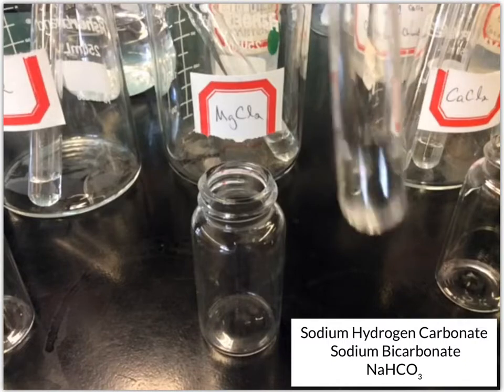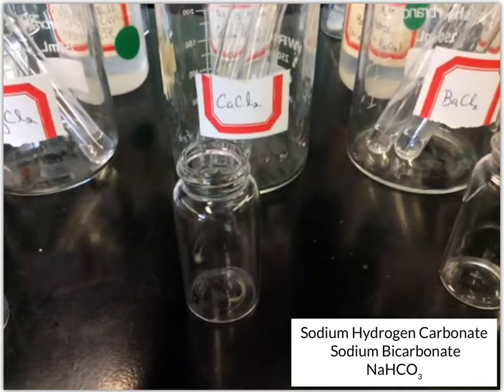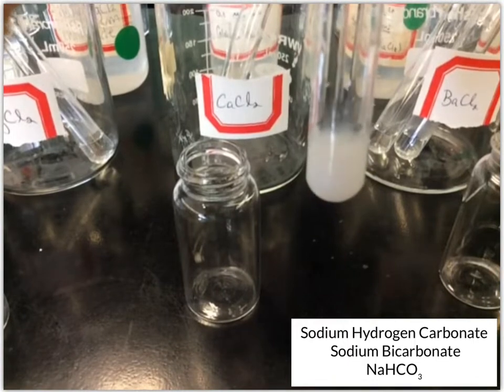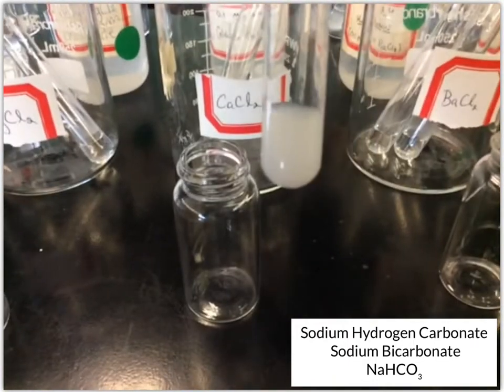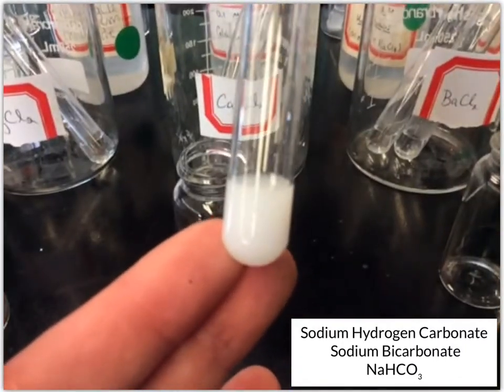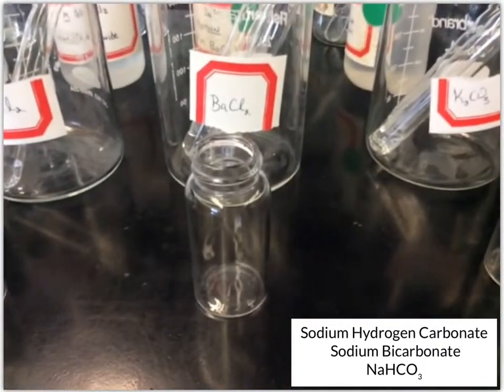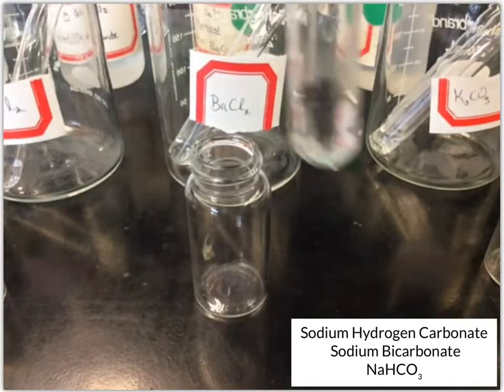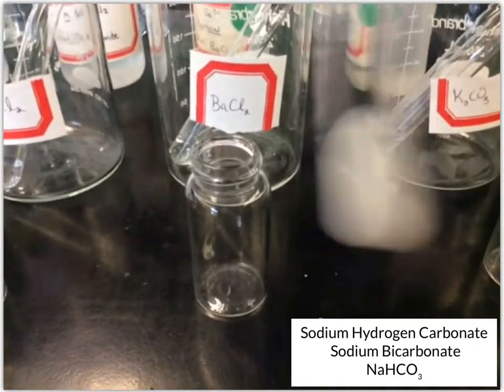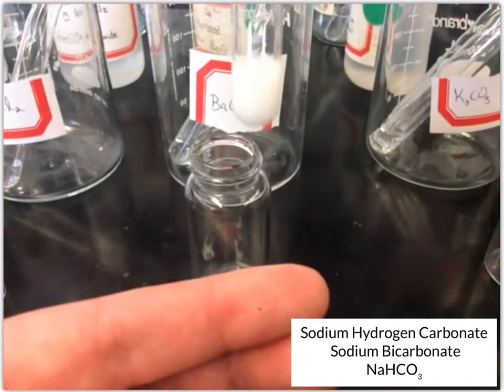Okay, so again, no change for that one. Then we've got our calcium chloride. Okay, so the calcium chloride, we got, again, kind of this white solution. So probably some solid in there. We'll let it sit as we do these others. Then we've got barium chloride. Okay, and similar to that calcium chloride, we again got kind of this white solution.